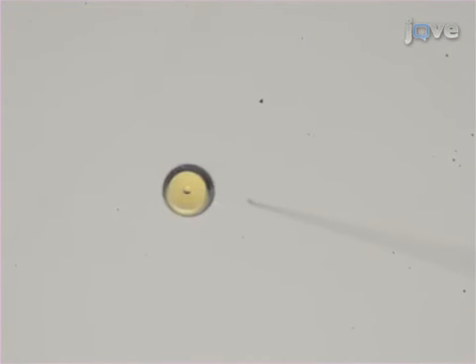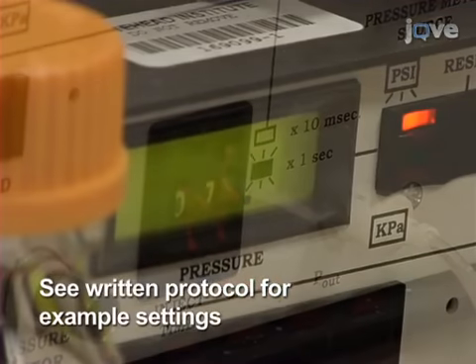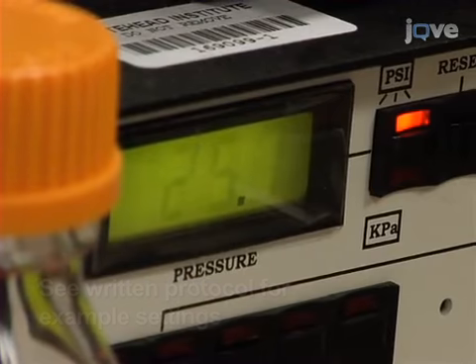Measure the drop size in oil, adjusting the injection time and pressure so that each injection delivers 1 nanoliter.